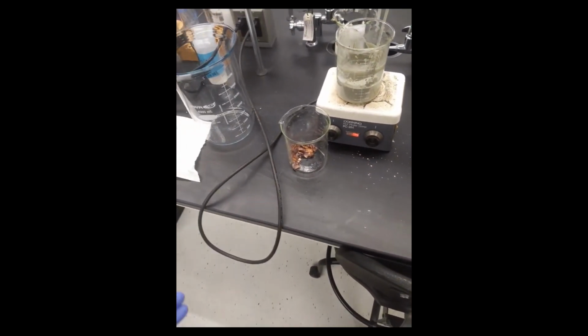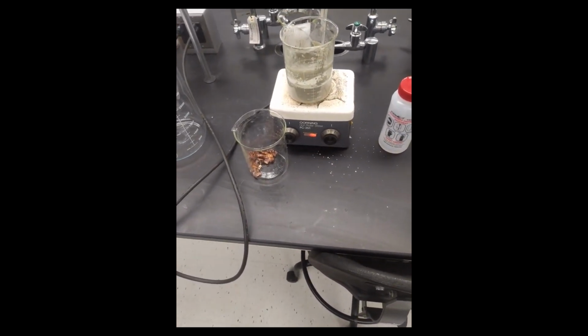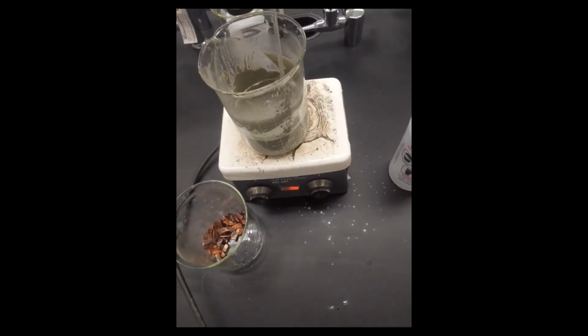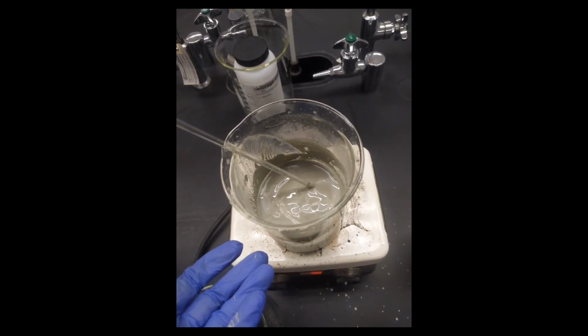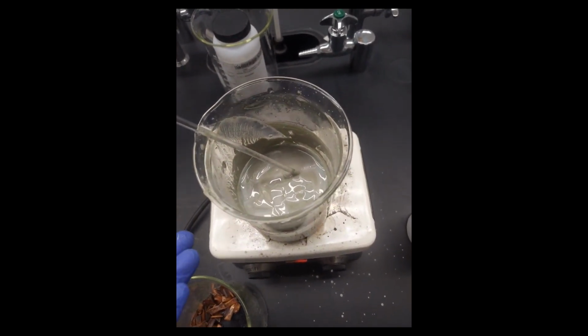So let's go through this, shall we? It's been like 4 days. It's Thursday, I started on Monday. And I've been getting silver this entire time. I've been trying to make silver powder. So here is tier one after all that. This is like the first thing that went off. It's minimally contaminated by copper, but there's still a little bit of copper nitrate in it.